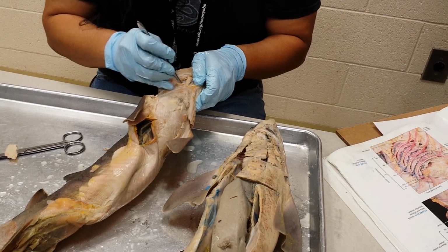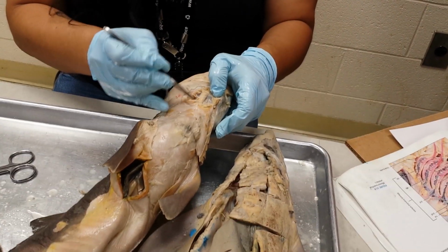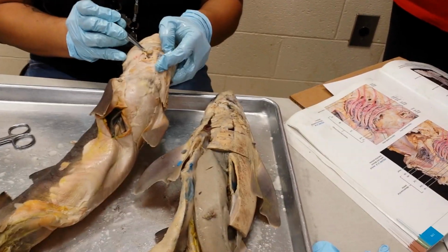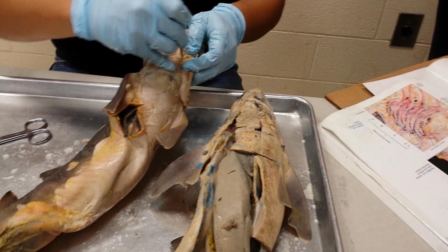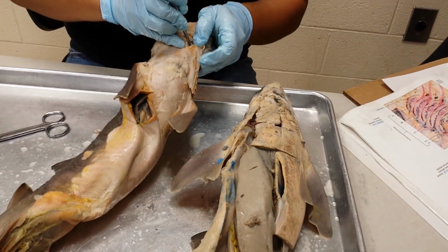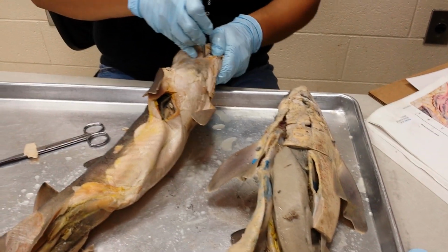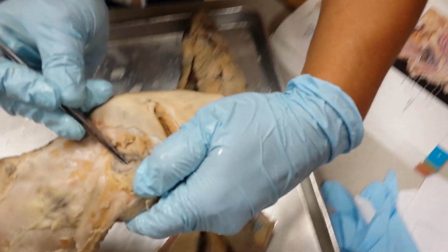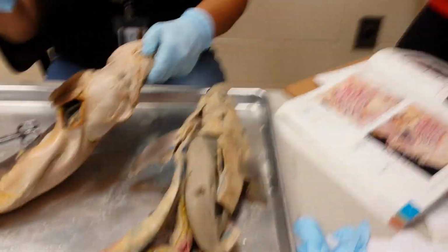Okay, I'm sorry, butchering the shark. You see there are strips of muscle lateral to the coracomandibularis. There's one strip here and one strip here. These are the coracohyoids. Coracomandibularis, coracohyoids. Now you'll have to dig deep underneath those coracohyoids, because there's another strip of muscle very deep to that. I just dug it up here. Those are the coracobranchials, branchial referring to the branchial basket, pharynx, all that stuff.